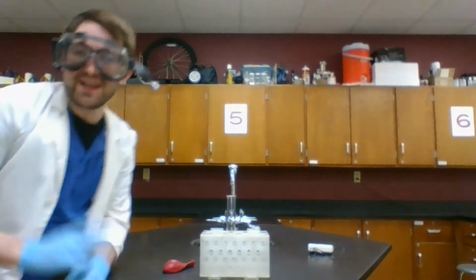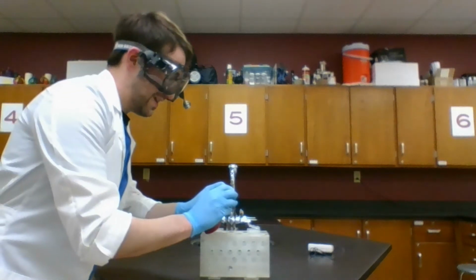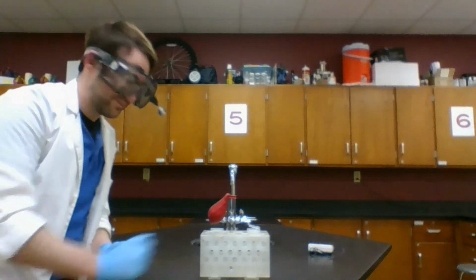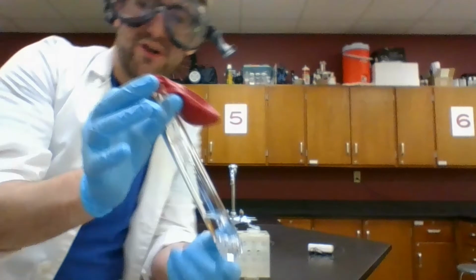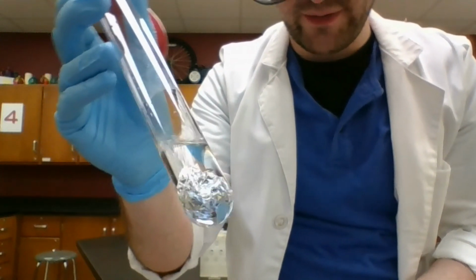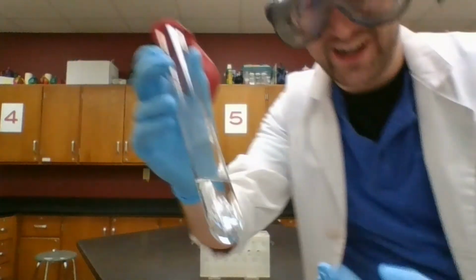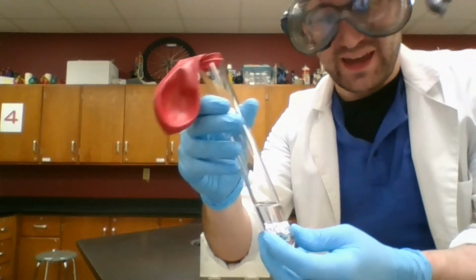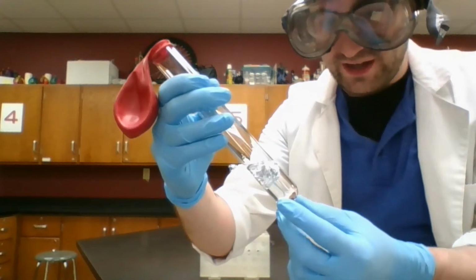Now, I should get a gas released from this. So I'm going to cover this up with a balloon, so that if I do get a gas out, I can capture it. You can see it. Well, so far, this is pretty boring. It's just sitting down on the bottom. Now, our aluminum foil has a layer on the outside. You can think of it like rust, but for aluminum: aluminum oxide, that the acid has to work its way through. But once it does, we're going to start getting a couple of bubbles.